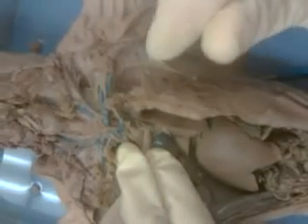And so here we have the first branch coming off of it. That's the brachiocephalic trunk, and that's going to give rise to both right and left common carotid arteries and the right subclavian artery. And then the second branch that's coming off, you can see it right here, that is the left subclavian artery, which is coming up here and starting out toward the left foreleg, okay?